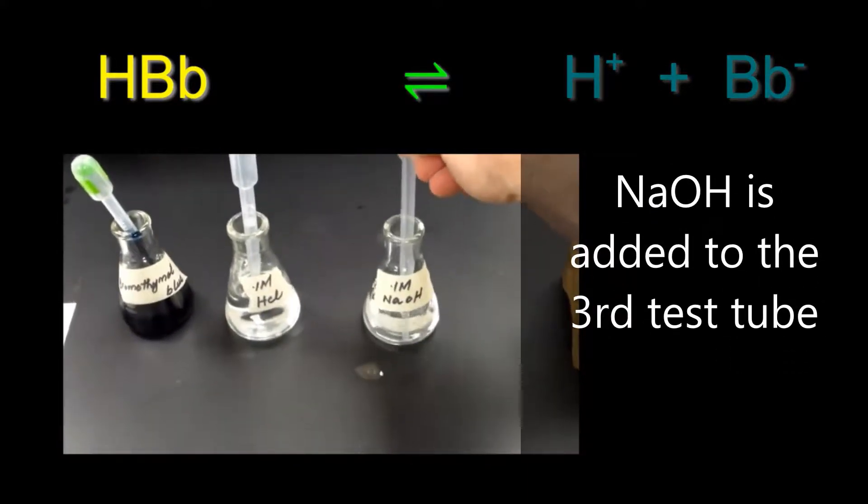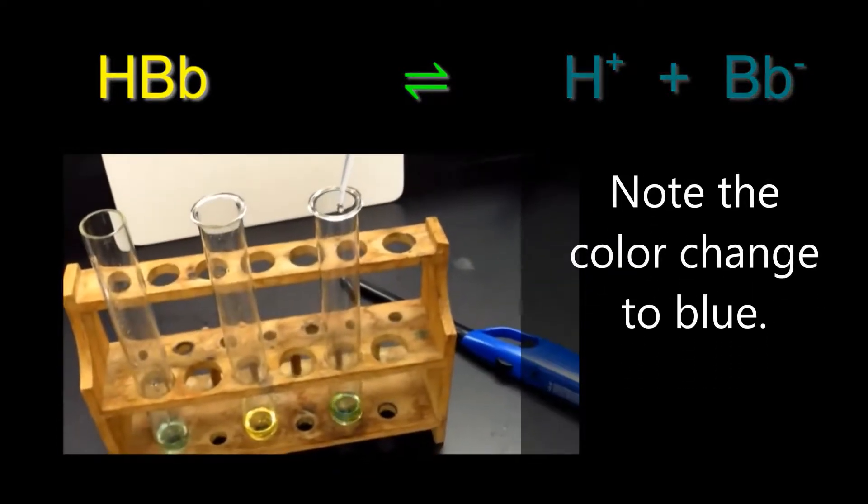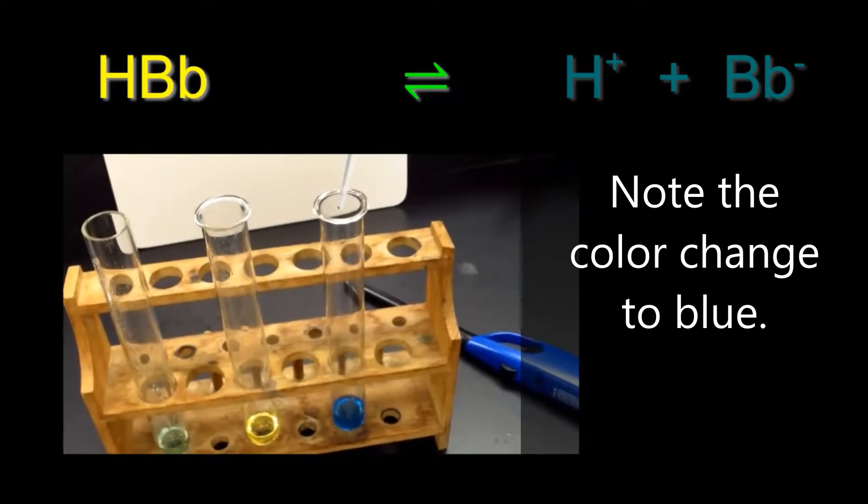Now the third test tube will have NaOH, sodium hydroxide, added to it. Notice that the color of this tube now turns to blue.